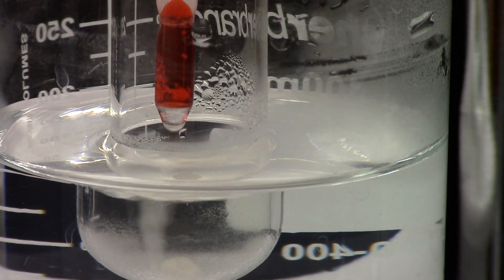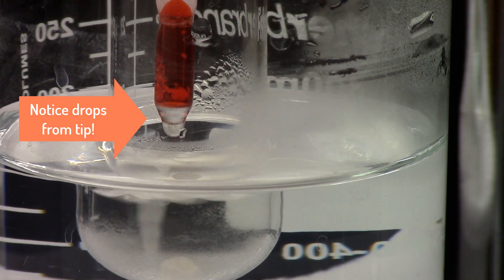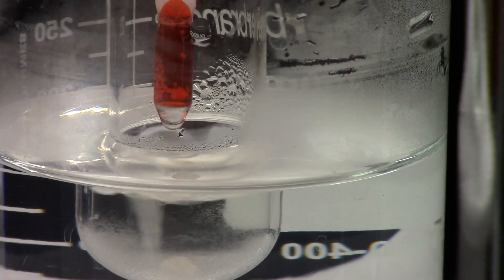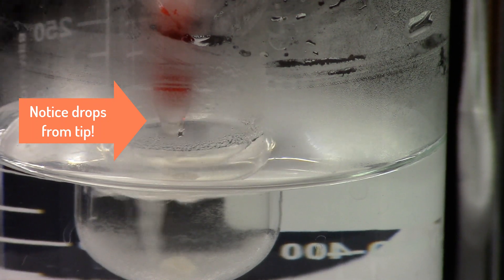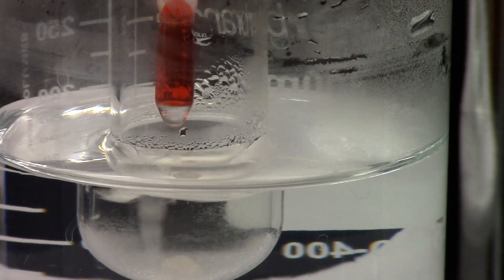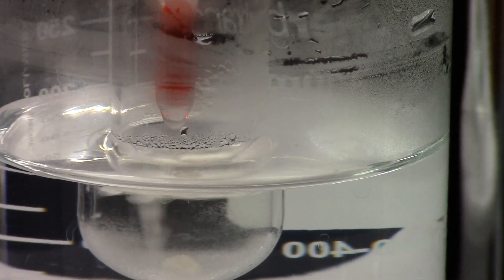We see a steady drip from the tip of the thermometer every few seconds, and we are going to look at the temperature on the thermometer.